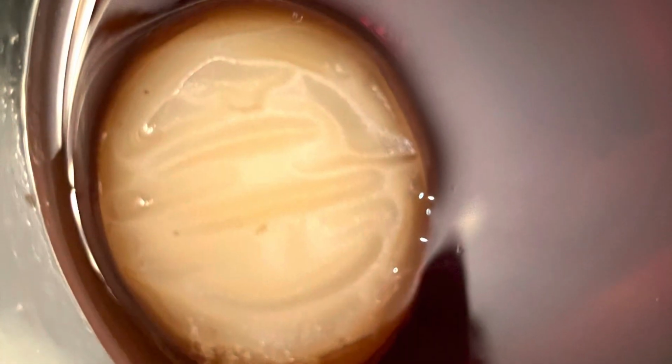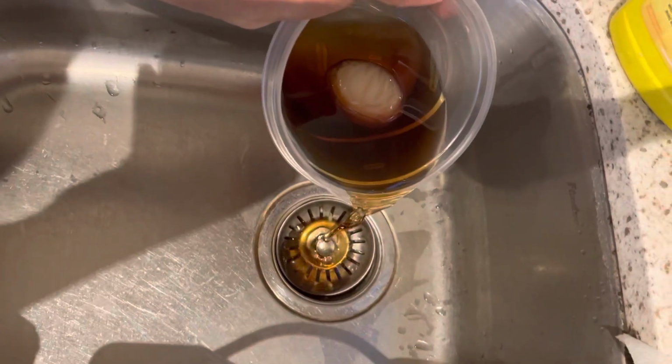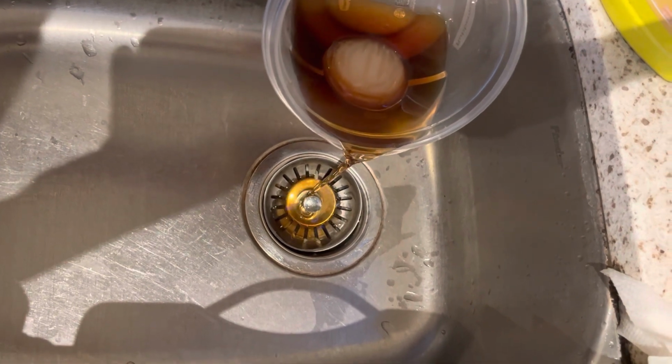There had been a decrease in volume, which lowered the turgor pressure in the cell. If I kept Egna in the syrup for a longer amount of time, she might have gone through crenation, which is animal cell death due to the lack of cytoplasm to function.